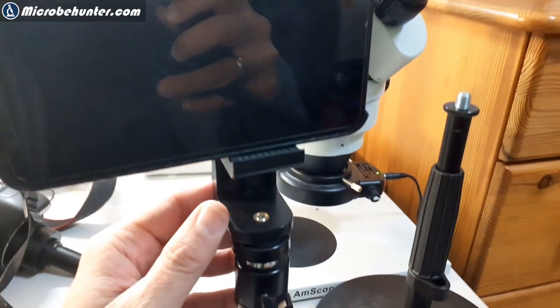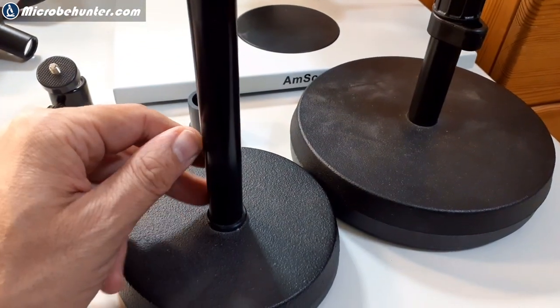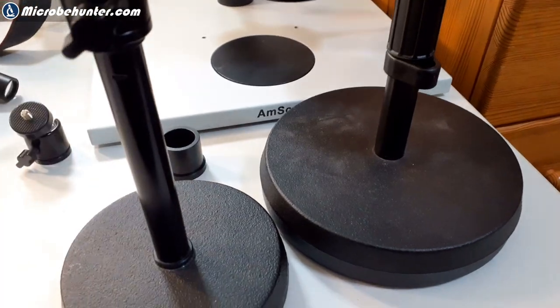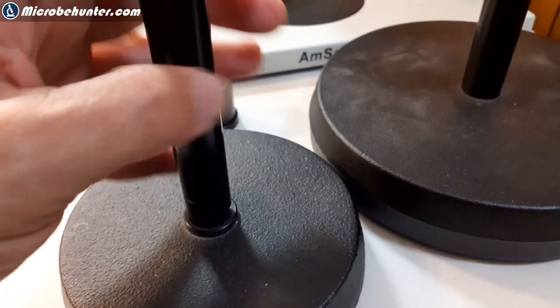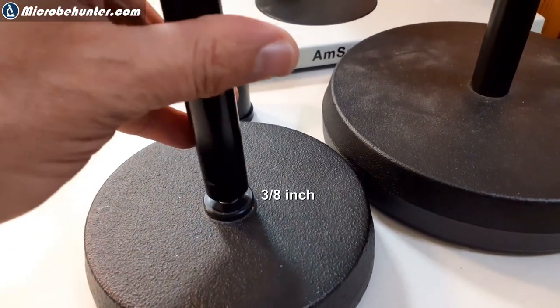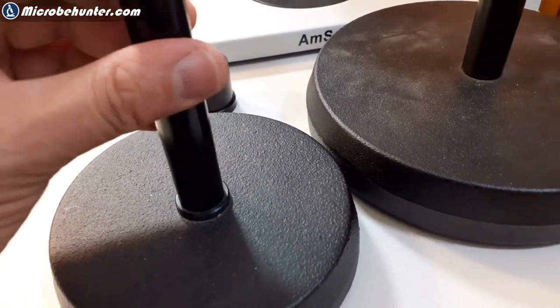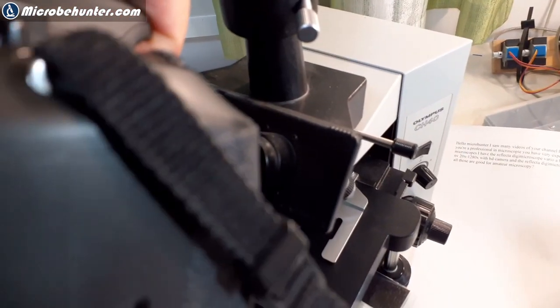You can also use this to connect mobile phone cameras. I also have a second stand here which is a bit smaller and cannot be extended, but it is possible to completely remove that stand. On the bottom it also has a 3/8-inch threading, which means I'm able to extend the microphone stand yet again by connecting another one of these stands — which is exactly what I've done.